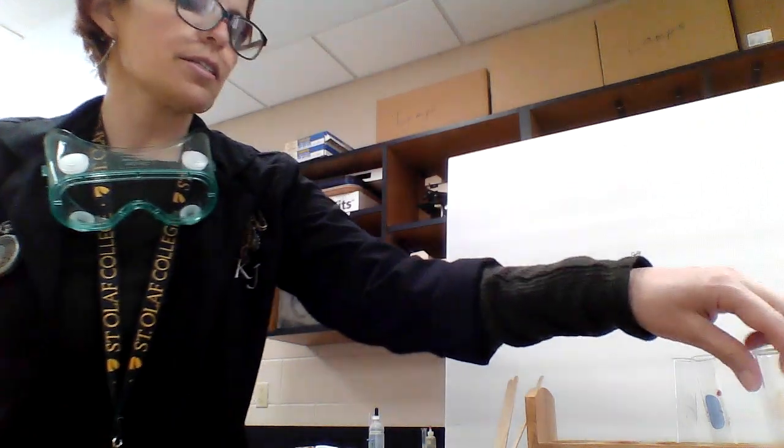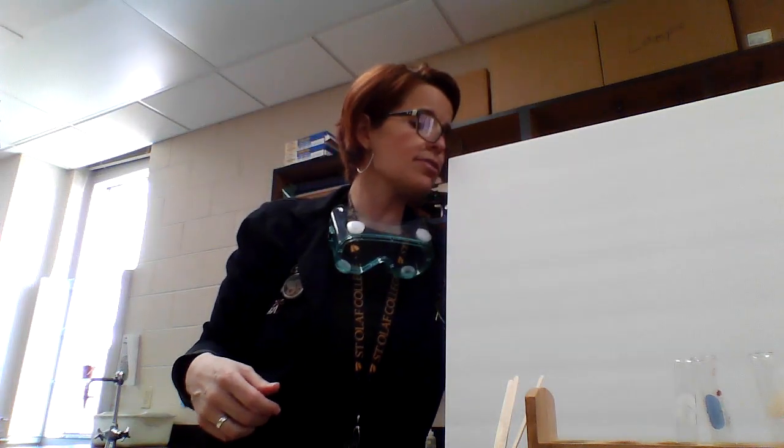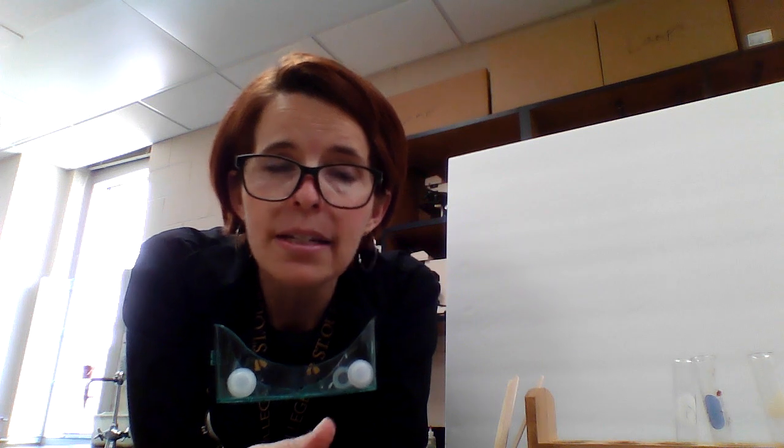All right, the next one that we're gonna do, I'm gonna take this test tube away. This was for the frozen liver, so we're not gonna do that one. Oh, and let's give some data for that one though. Let's say the initial temperature is 26, the final temperature is 27 because it warms up over time. We'll say the bubbles, we'll give it a 10 also. The bubbles are really high for it. And then the splint test, we would say a yes for that one. So that one's definitely a positive also.